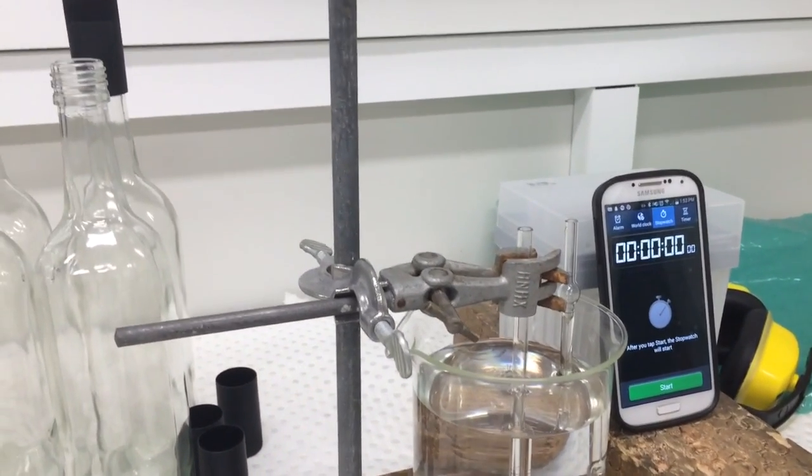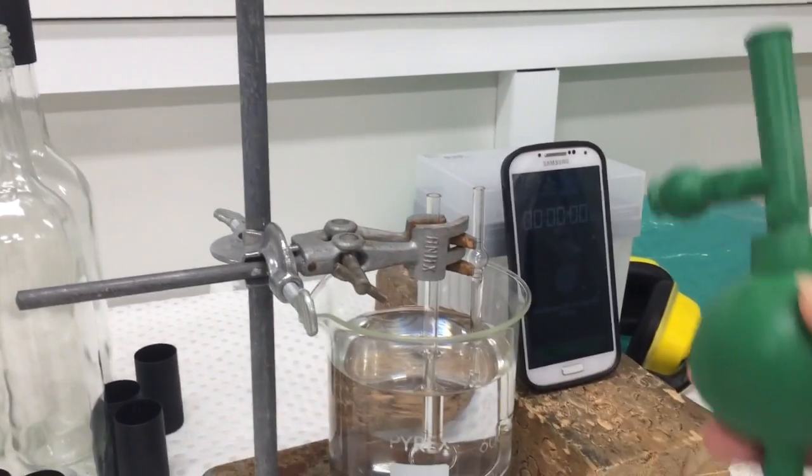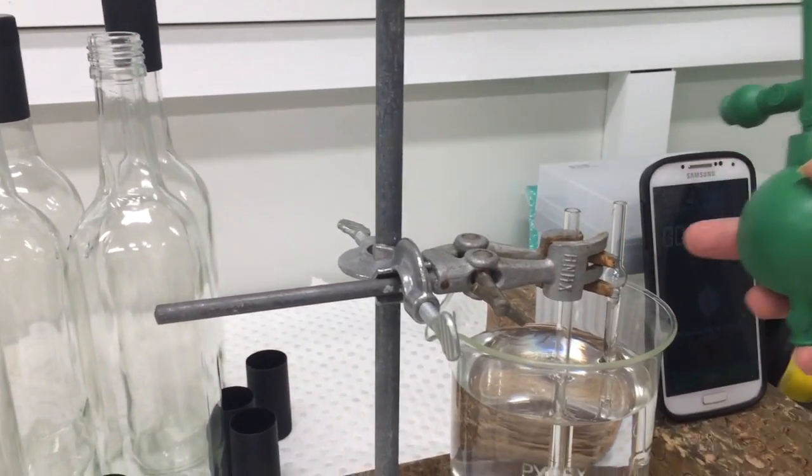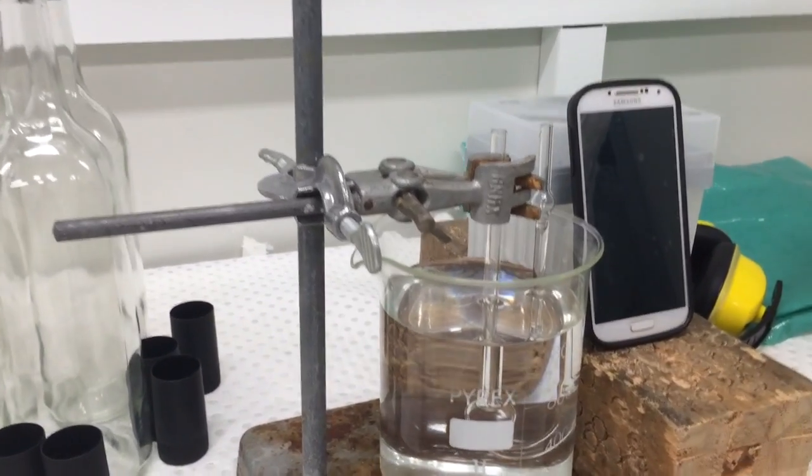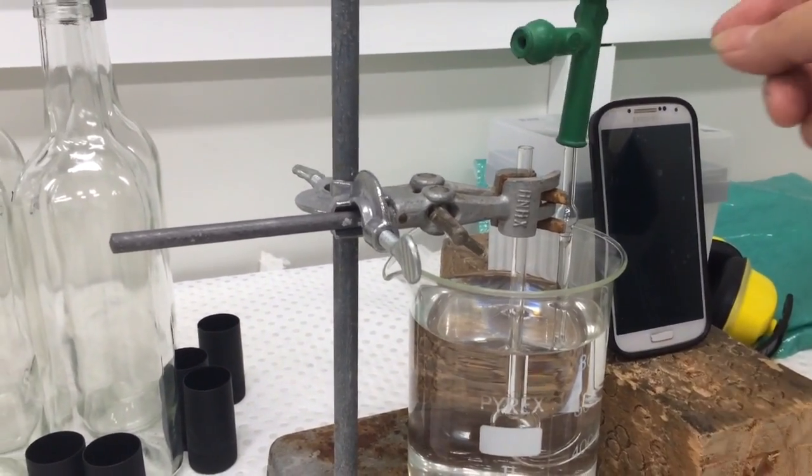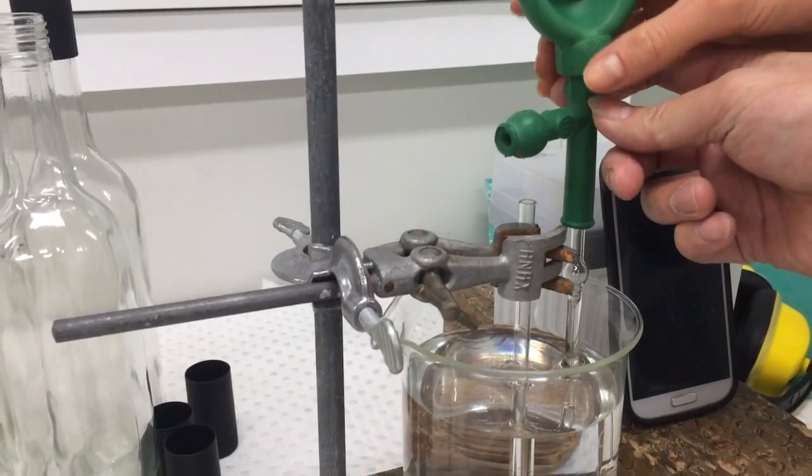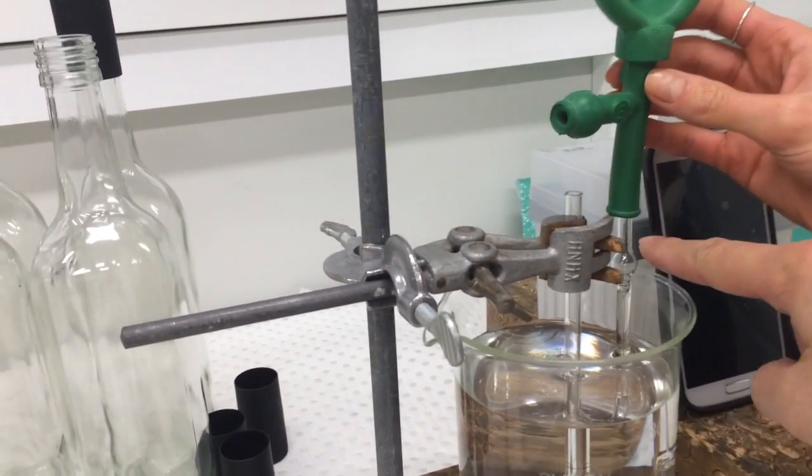So if the temperature is okay, you can start to get down to get above that line. How far am I sucking it up? Above that line.